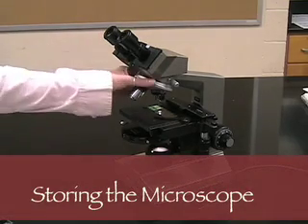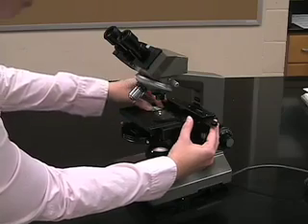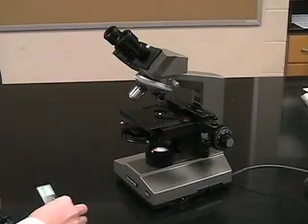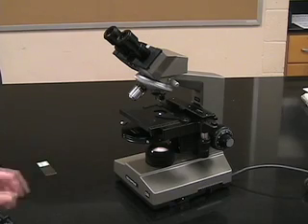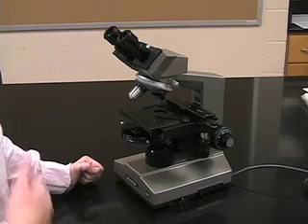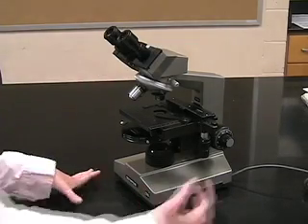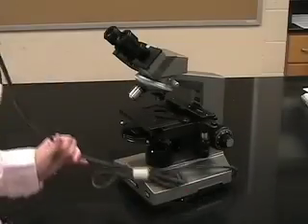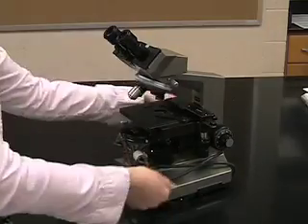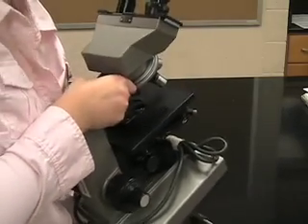When turning off the scope, first shift the objective lenses back down to the 4x objective lens. This ensures that when you remove the slide, you won't damage the slide or the lenses. Remove your slide, then return the light sliding knob all the way back down to the lowest setting so you don't affect the next student's eyes. Then flip the switch to off, unplug the scope, wrap the cord around the scope, put the cover over it, and lift it using the arm piece while supporting the base to return it to its storage cubby.